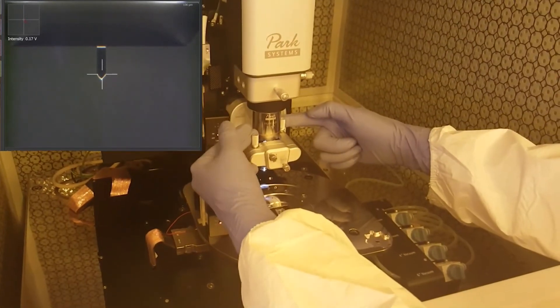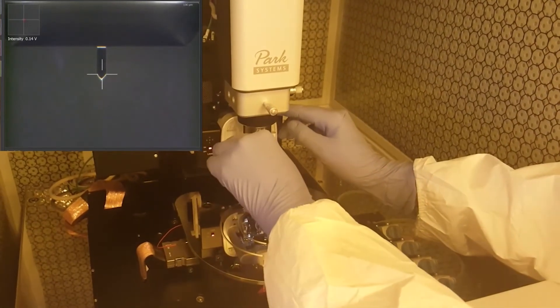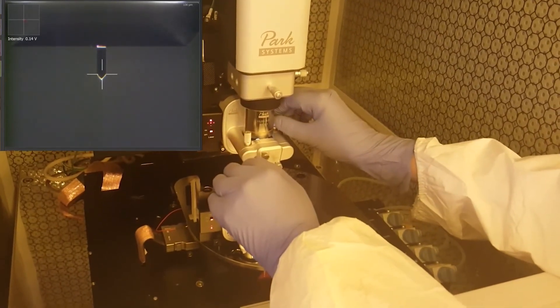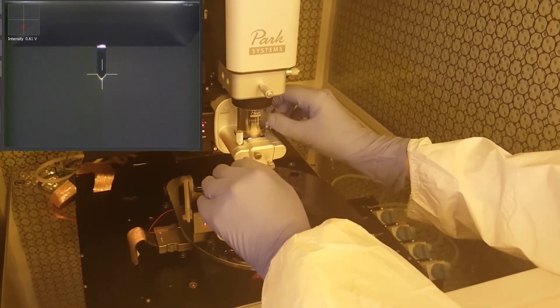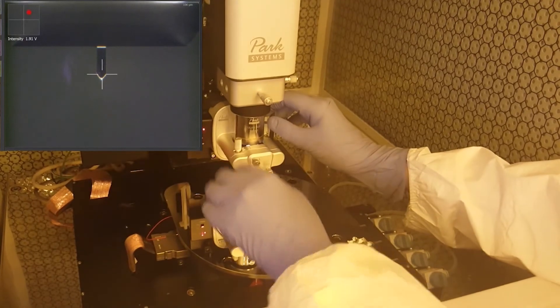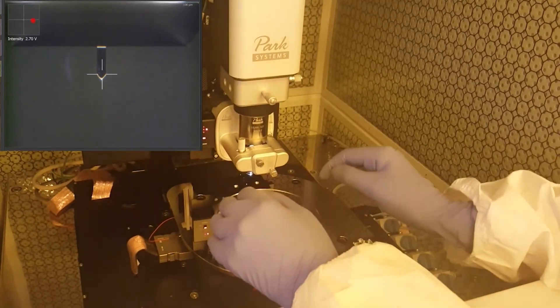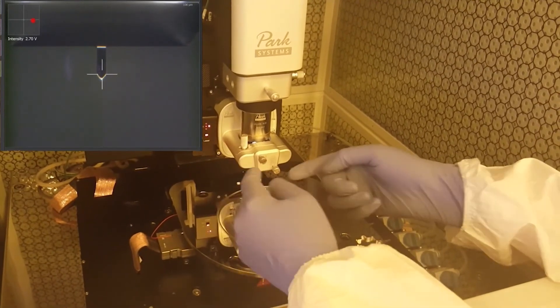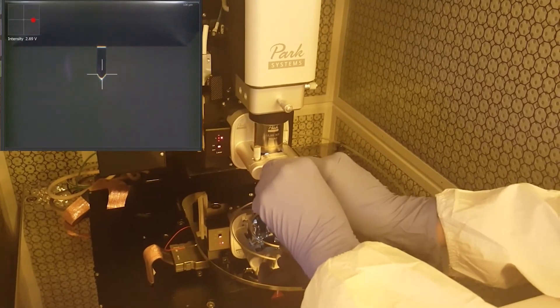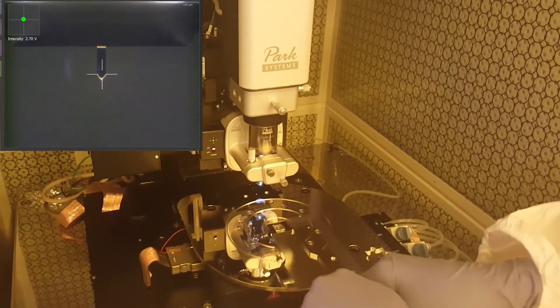To find the laser, turn the laser knobs to move it up and down until laser light reflects off the wide mount of the cantilever. Then move it left to right until it's centered over the narrow part of the cantilever tip, and move it down until it's approximately over the guide. If you move it down too far, you'll lose intensity and get a noisier measurement, so back it up slightly. Once the laser is approximately positioned, use the PSPD knobs — one goes up and down, the other left to right — to center the laser on the photo detector until the circle turns green.